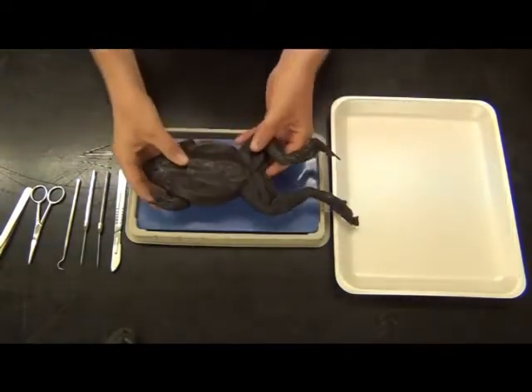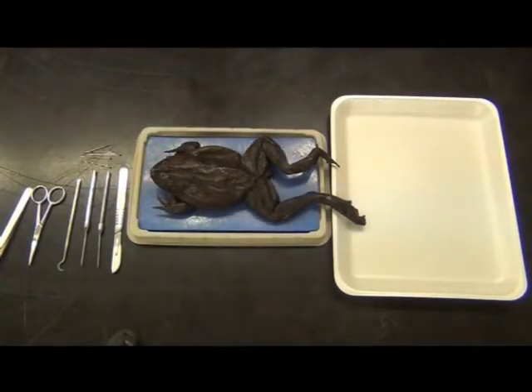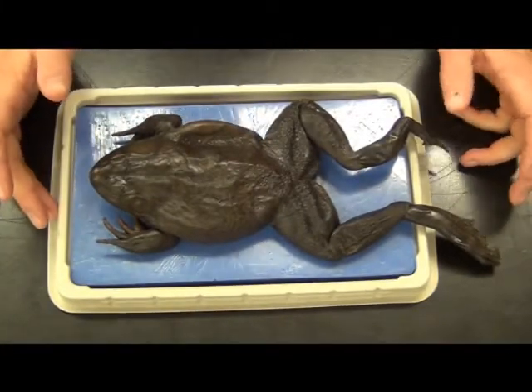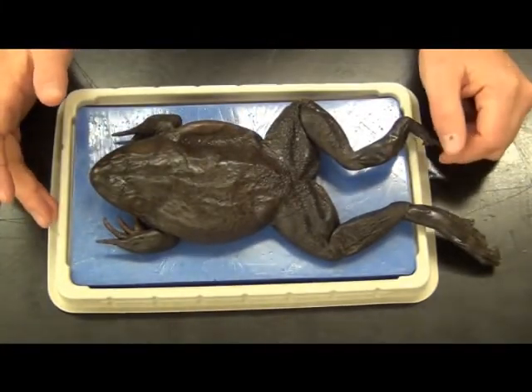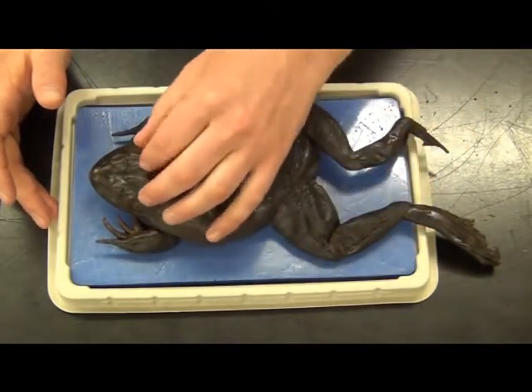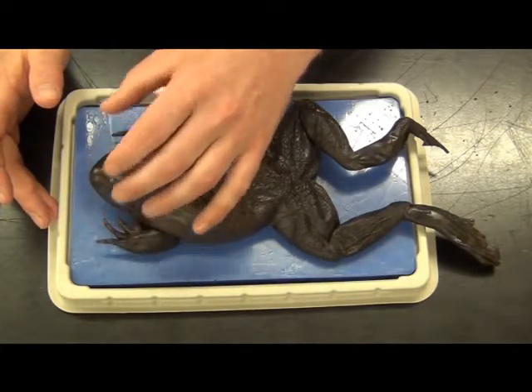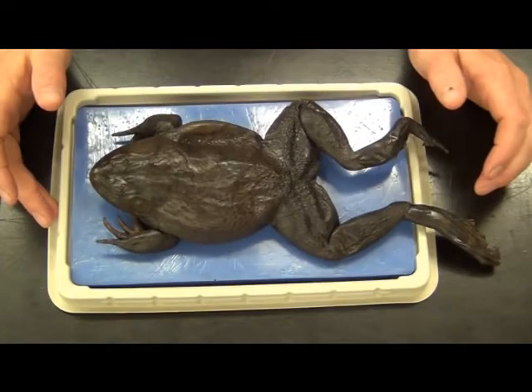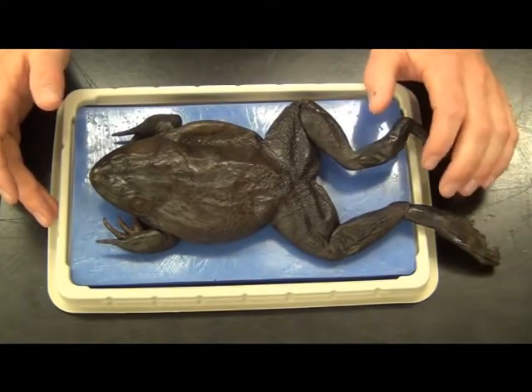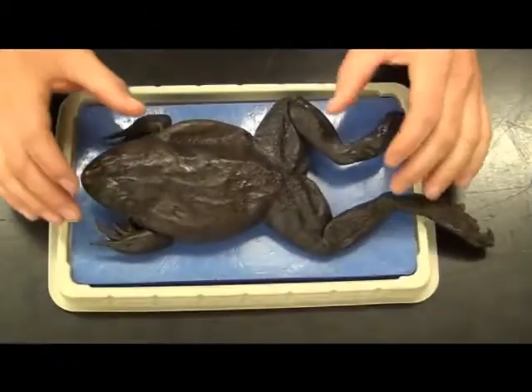Let's start with the external features. Externally, this all looks fairly familiar. We have the standard tetrapod body plan: two arms, two legs, a cranium housing a very small brain, some eyes, some nostrils, and the mouth. We've all seen it before. But as they are amphibians, we're going to see some differences from our mammalian counterparts.